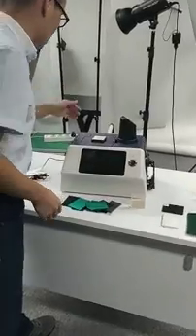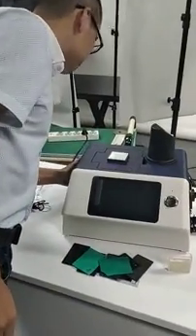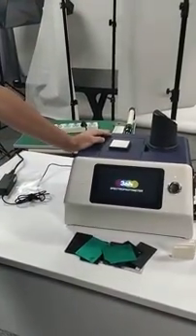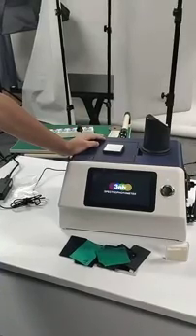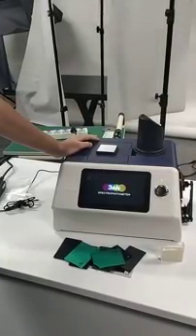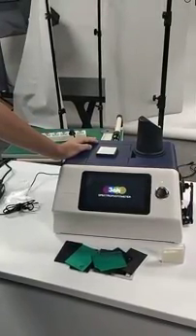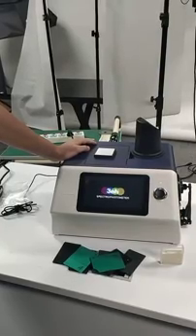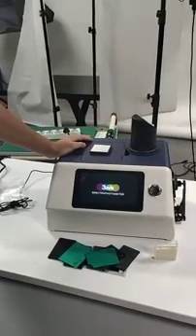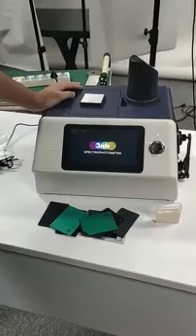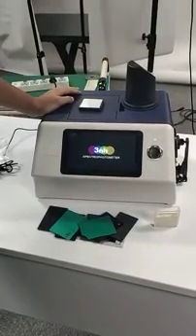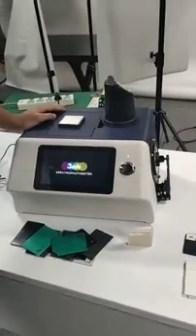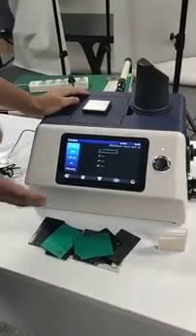First let's turn it on, switch it on. Ok, it's ready.